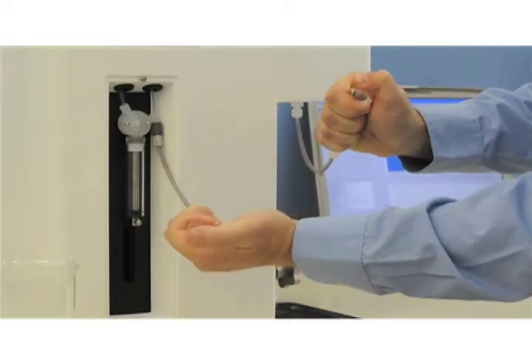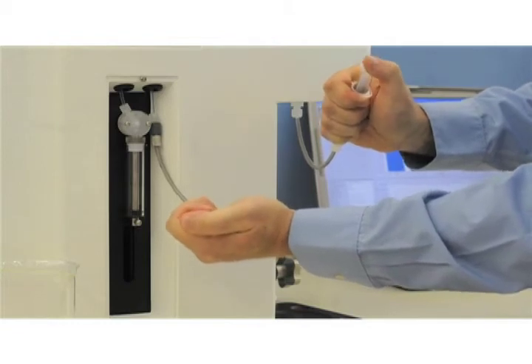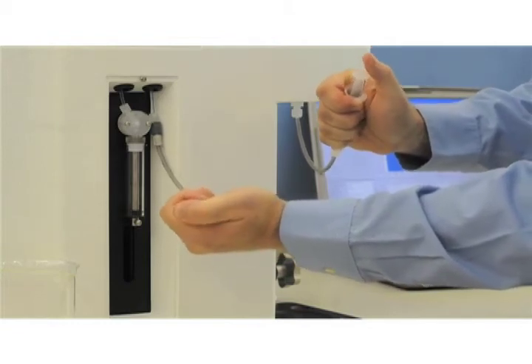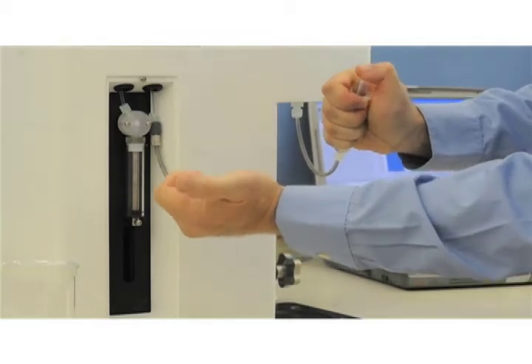Alternately force the cleaning solution back and forth between the two cleaning syringes for anywhere between 30 seconds to 1 minute. Vary the technique between long slow strokes and short quick strokes for best results.